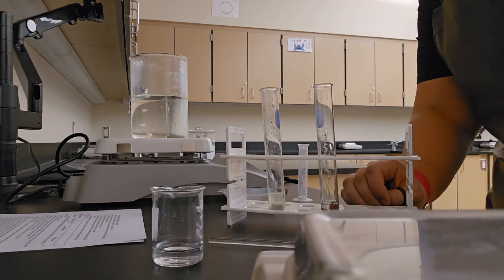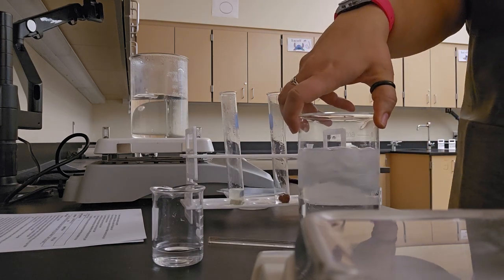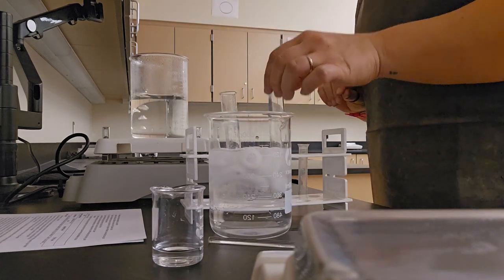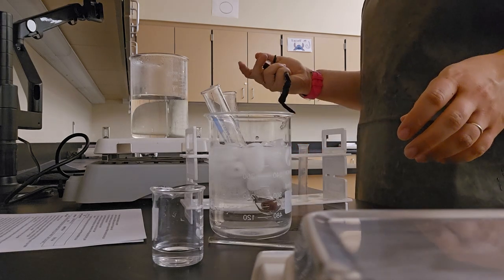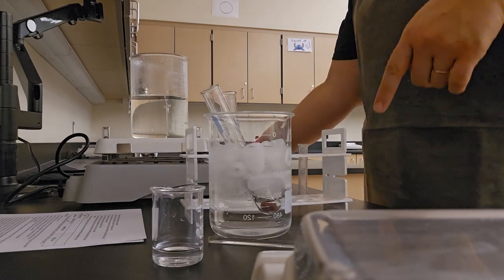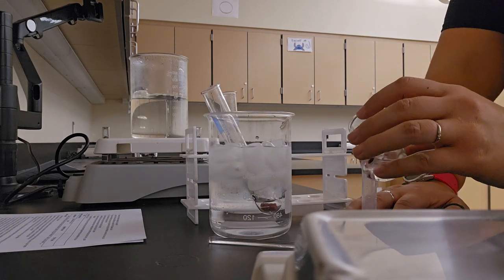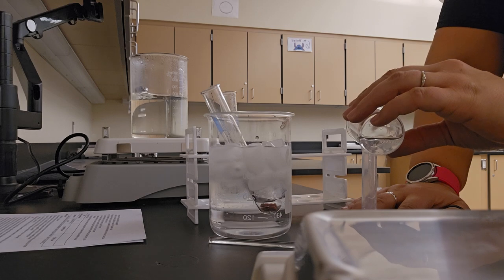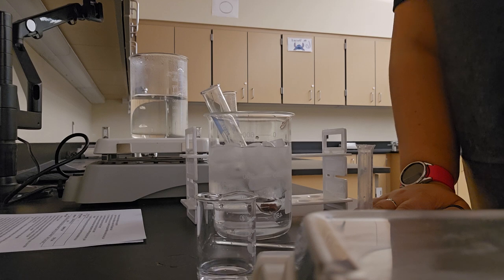And this time, it's going to go into a cold water ice bath. And this time, instead of 3 minutes, it's going to be 5 minutes. So, second test tube, in it goes. Reset my timer. 5 minutes this time. While that's going, I'll pour out another 2 milliliters of my hydrogen peroxide to test for enzyme activity at the end of this 5 minutes. So, see you back at the 5 minute mark.